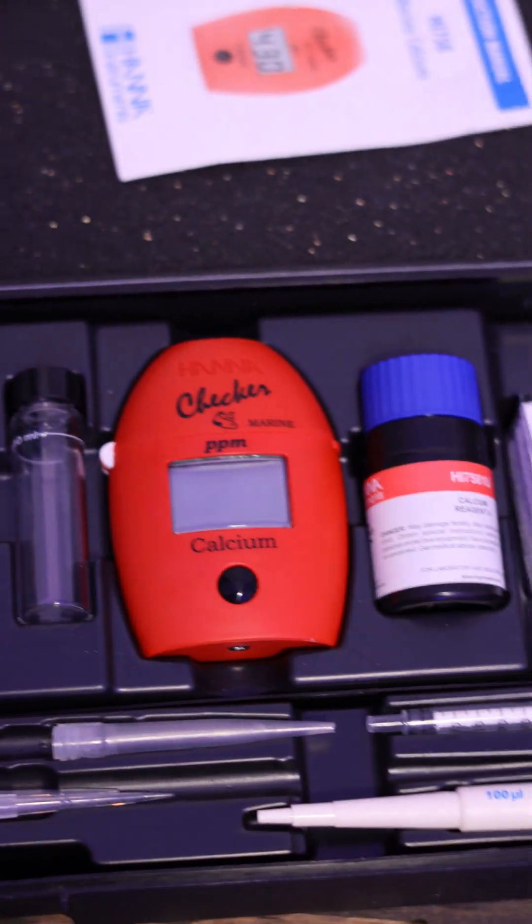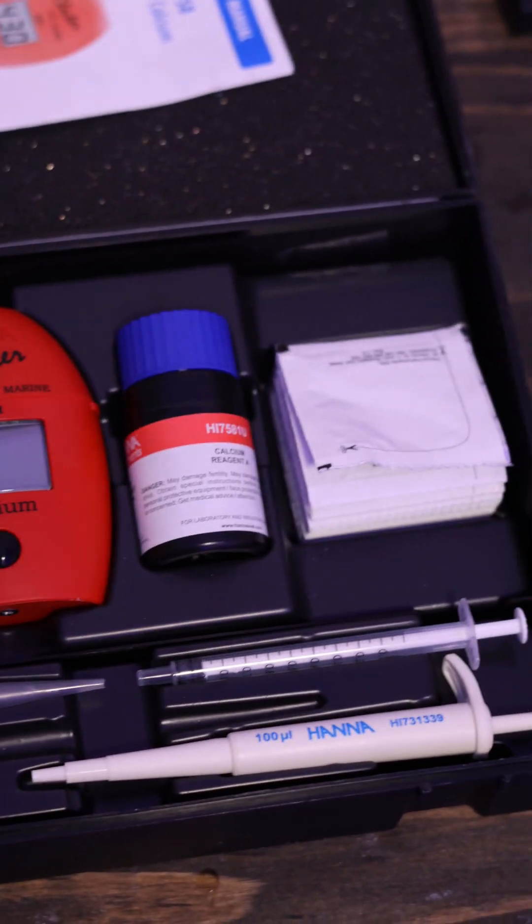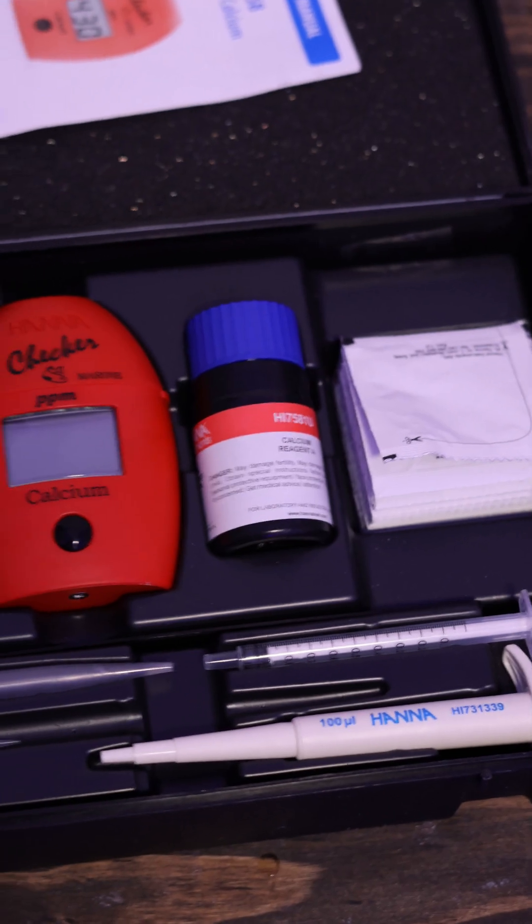Do you want to know how to use a Hanna calcium checker? This is probably the most convoluted and easiest to mess up Hanna checker there is.